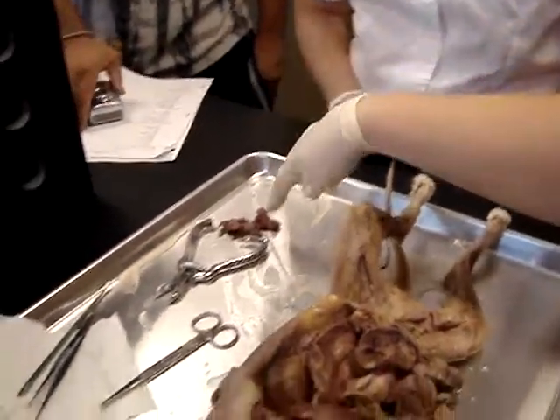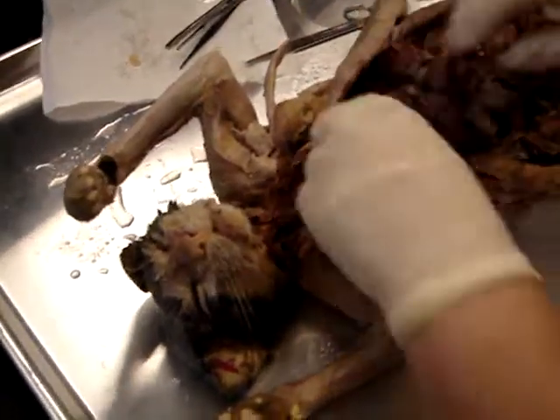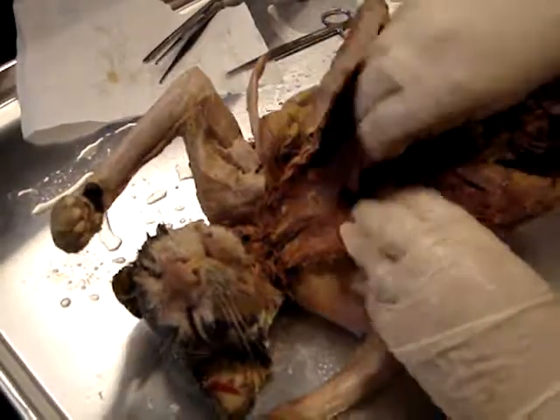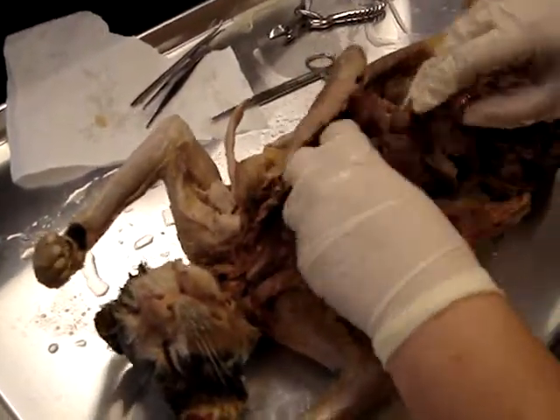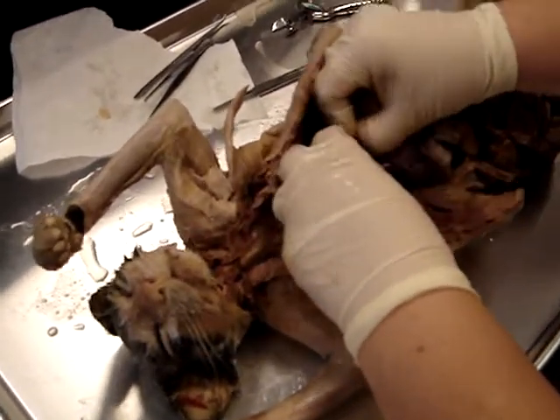That's all thymus. That's a pile of thymus. Okay. Because that was sitting on top of the... That was sitting on top. It was sitting like right here. It's not close to it? So yeah. Oh, okay. It is. So I picked off a big pile of thymus. That tells you that our cats are relatively young if they have a big old thymus.